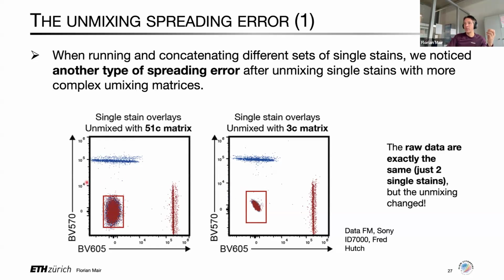And I want to emphasize here that these 2 plots are exactly on the same scale. There is no change in scales and transformations here. And for clarity, I've put this red box around, which have the same size, these 2 red boxes. So you can see that there's really a drastically increased spread that affects basically all the events in your measurement.